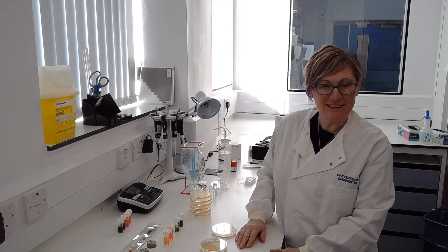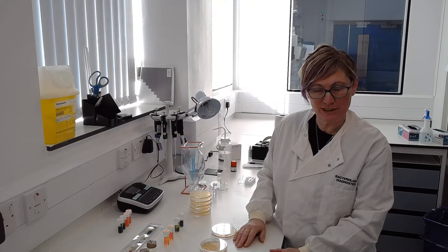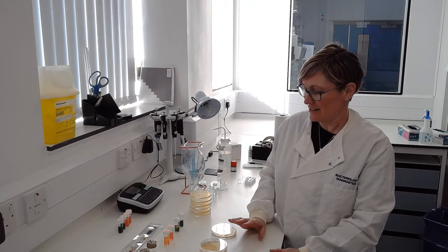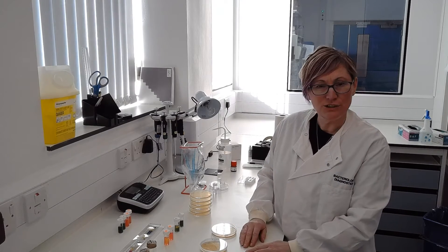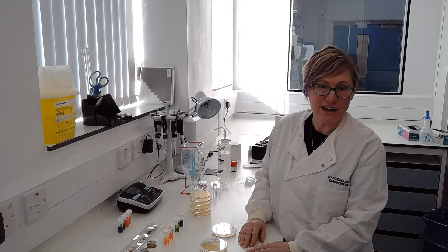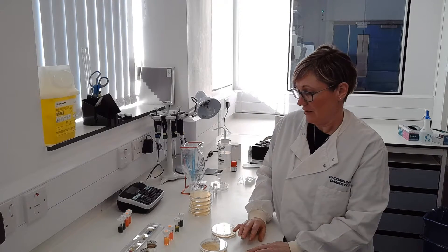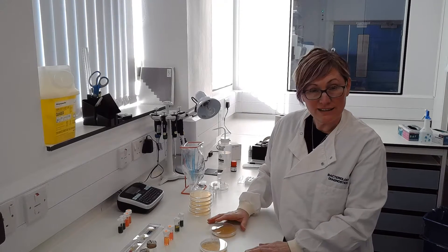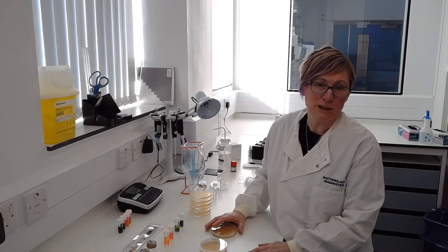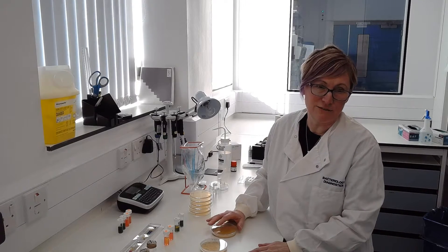Hi, I'm Alison and I'm a microbiologist at Marine Scotland Science. Today we're going to show you a few of the things that I do day-to-day in the lab to identify bacteria. The reason we identify them is to try to see if they might be responsible for disease in fish.